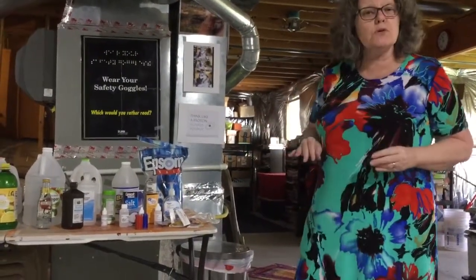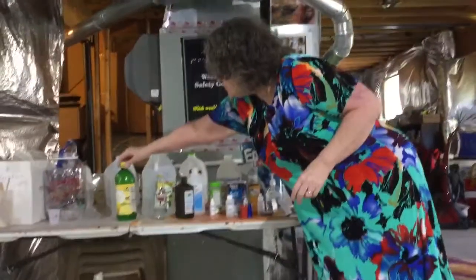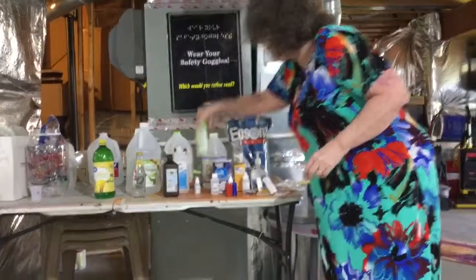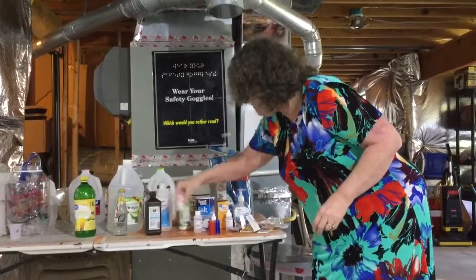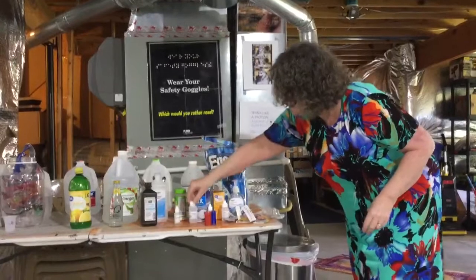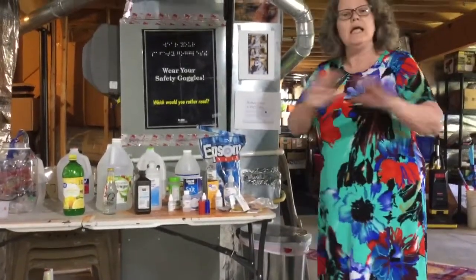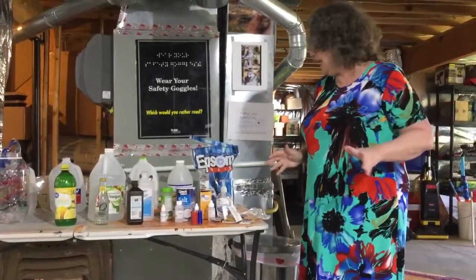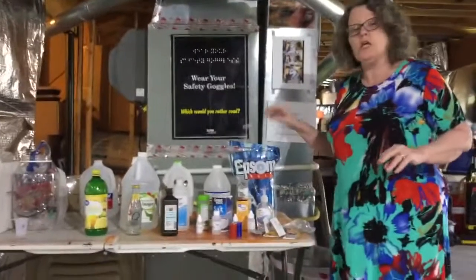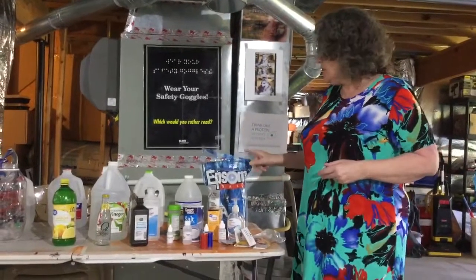So I pulled a number of household chemicals to use for the lab, like vinegar, lemon juice, tonic water, peroxide, alcohol, citric acid powder. I have borax solutions, mouthwash, salt, baking soda, hand soap. You can use shampoo. Any of these household chemicals are fine. If you use something like salt or baking soda, Epsom salts, you must put it in water. It won't register a change in pH when it's dry.